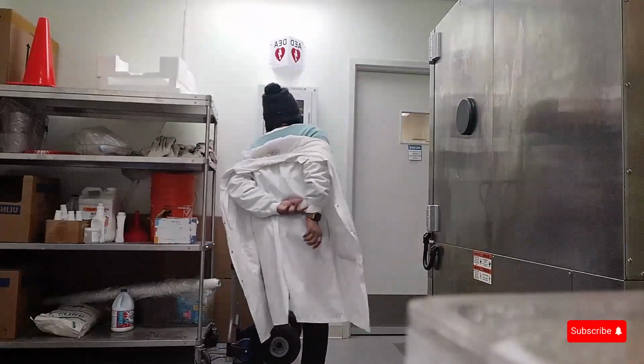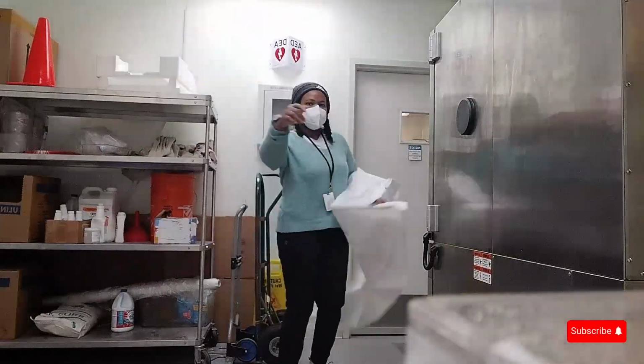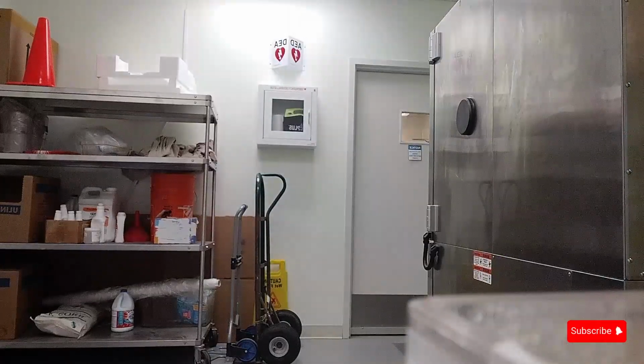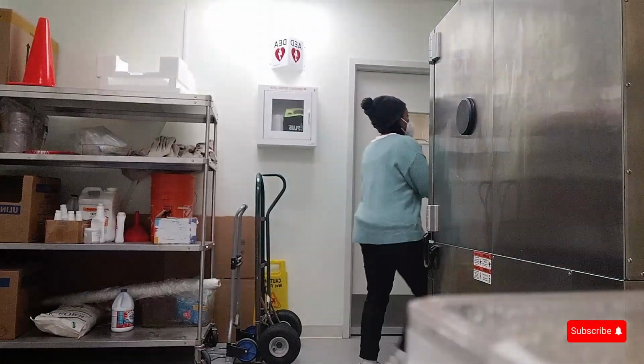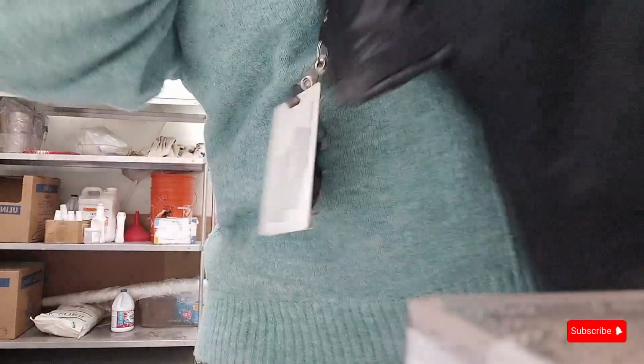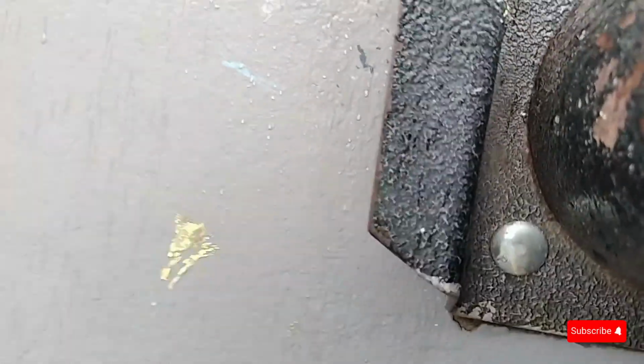So each type of microbe has a specific growth requirement. For example, specific nutrient type, whether they want lots of vegetable or lots of sugar, different substrate type, and different environmental conditions, for example pH, light, and temperature. As I said, the incubator that I usually use is under, not construction, they're replacing the light, I think. So I'm going to put them in the growth chamber, and I use a standard light-dark cycle, standard temperature, normal humidity.